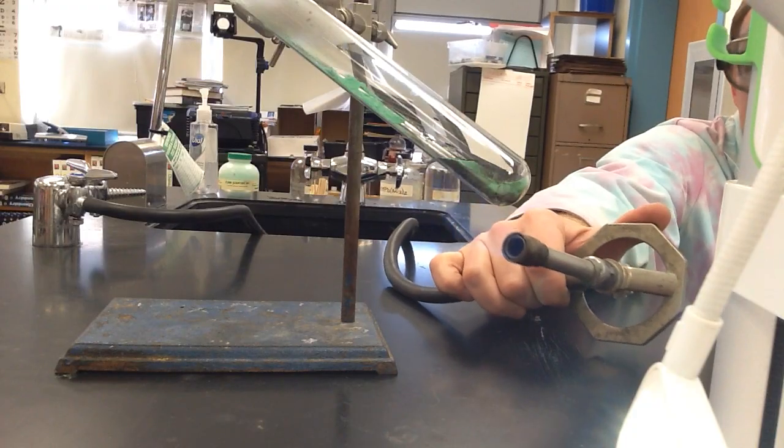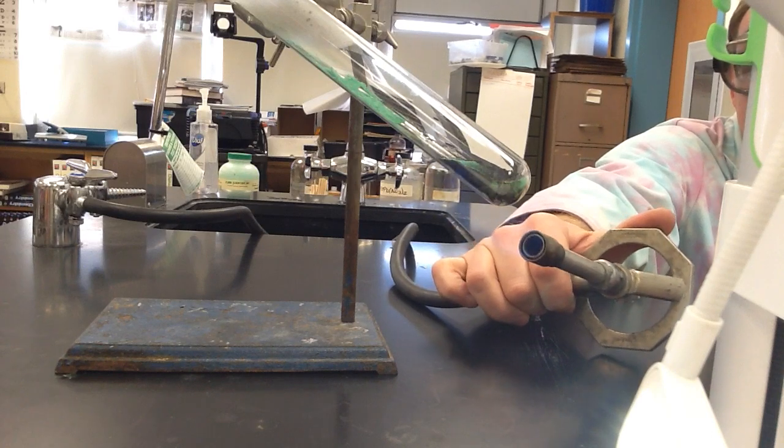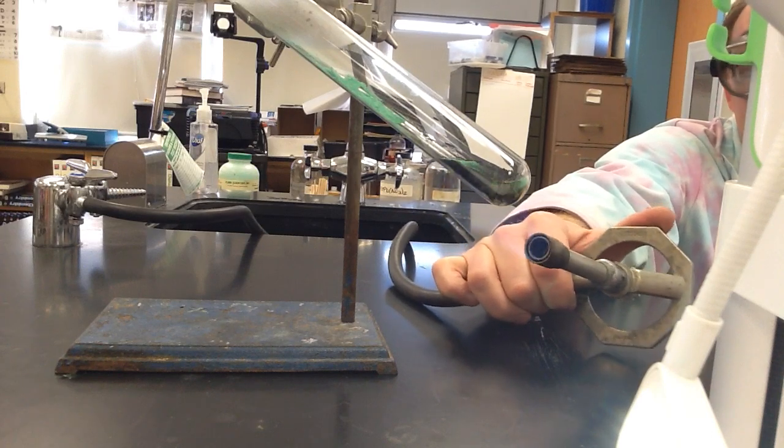It's turning black, okay. It's a dark brown. Thank you. There could be dark brown, too.